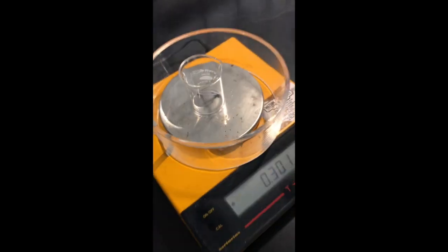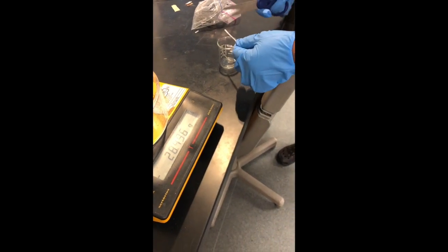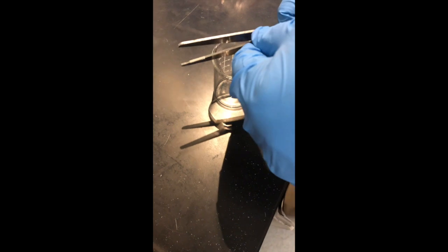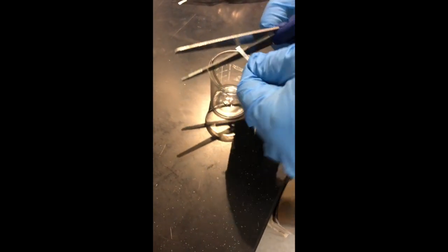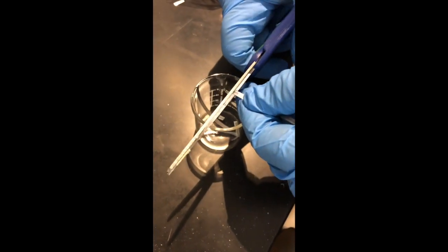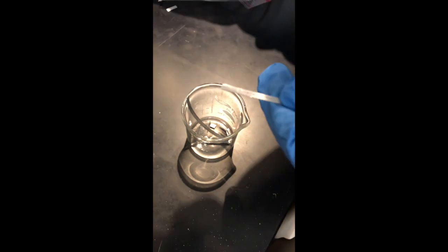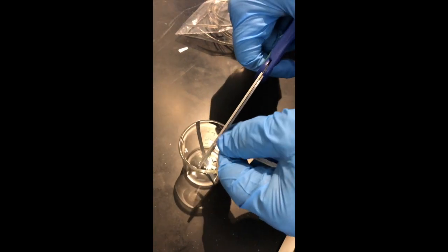Now we're going to cut that magnesium into small strips, about one centimeter or less each. We'll continue cutting that into strips and then add that to our dried reaction flask — as long as they're not flying across the room, which tends to happen.